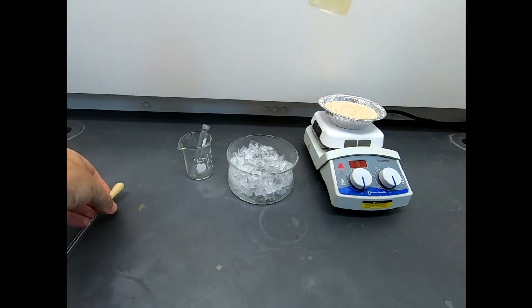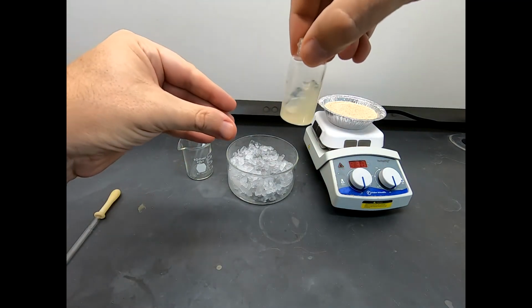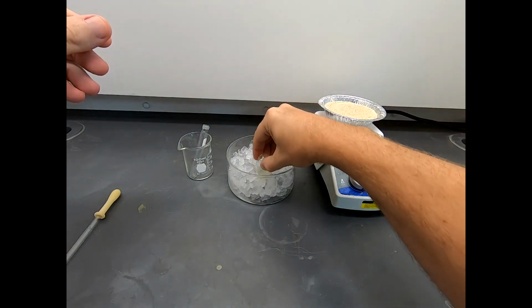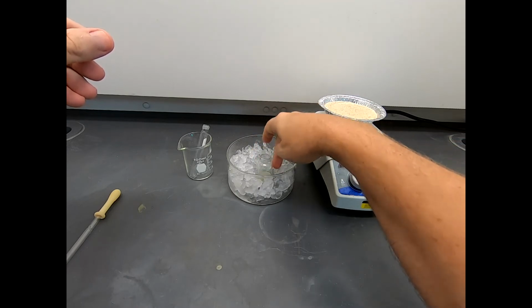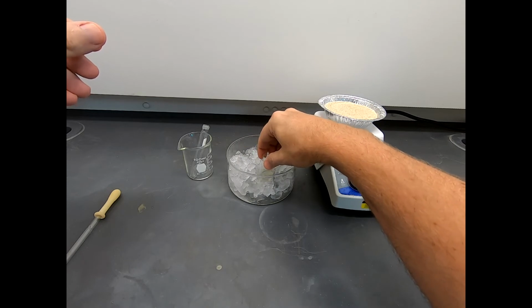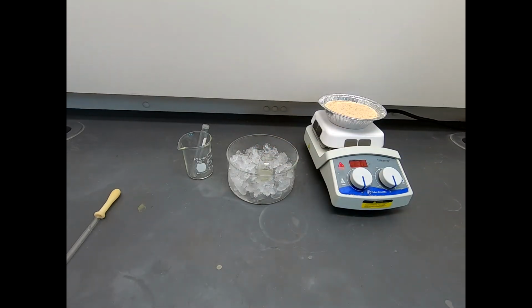Now that is definitely looking a little bit cloudy. If we could speak chemical, we might hear the chemical saying, "Oh boy, please let me precipitate." So let's put this on ice and give this a little bit of time on ice. And I think what we're going to see is some nice solid formation. So I'm going to turn off the camera just for a bit, but I wouldn't be surprised if this just takes a few minutes to see some solid.